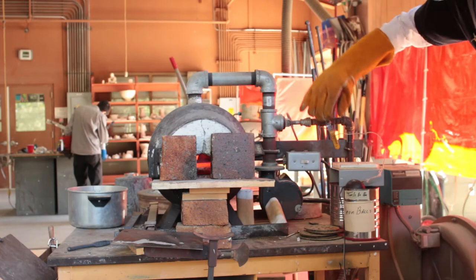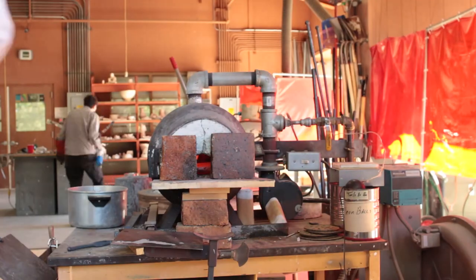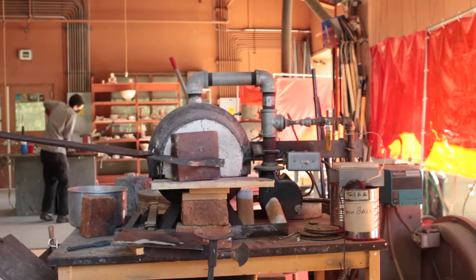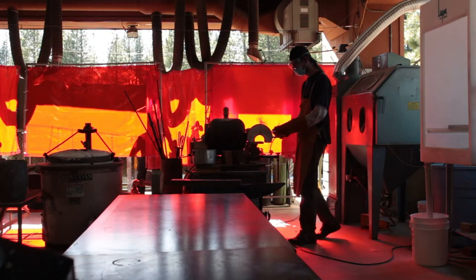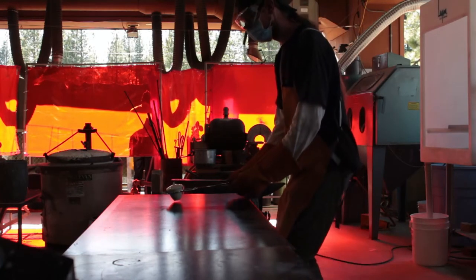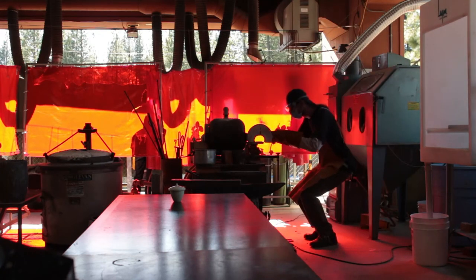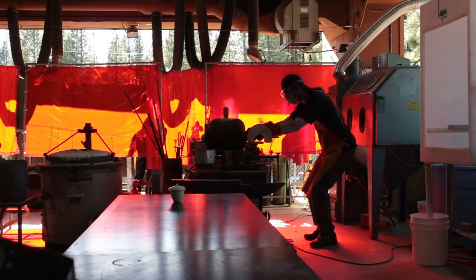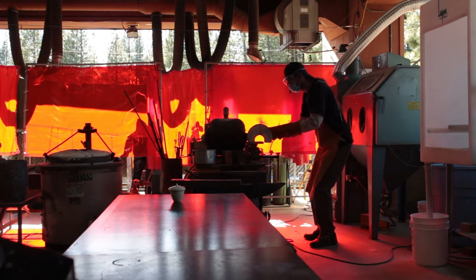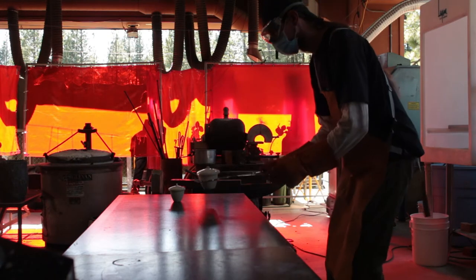After four hours, I'd cut the heat and open up the furnace so the crucible could cool down. At this point in Hammerton's procedure, I would cool the furnace to 500°C, remove the crucible lids, and pour in an additional charge of sulfur — which immediately catches fire and blasts you with sulfur dioxide and sulfur trioxide fumes. Even with a respirator on, that's not my idea of a good time, so I decided to do this stepwise: the reduction fire one day, the oxidation fire another day.